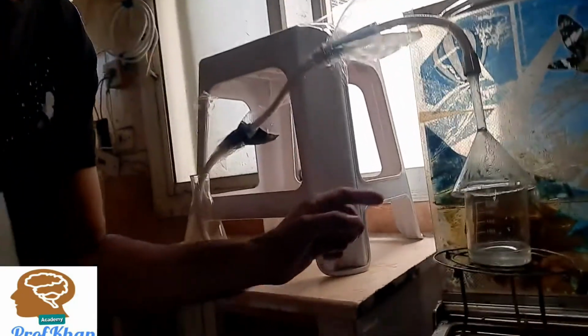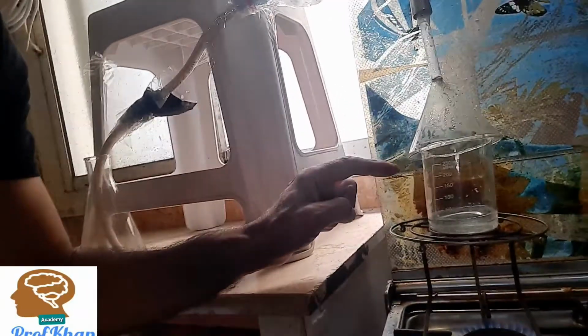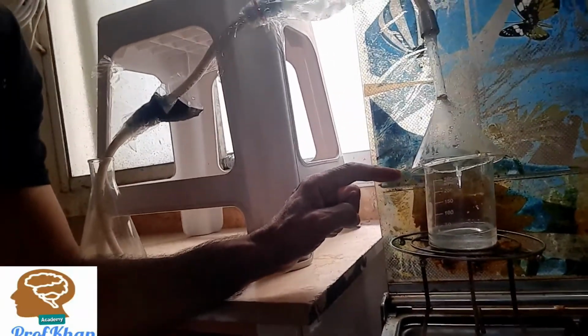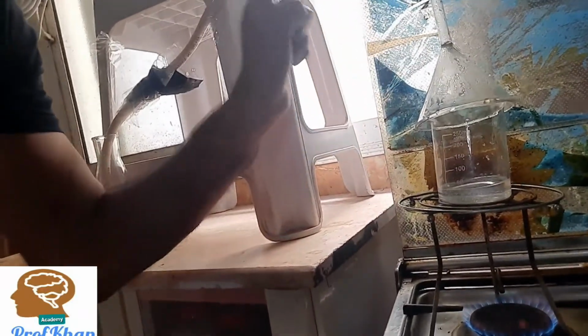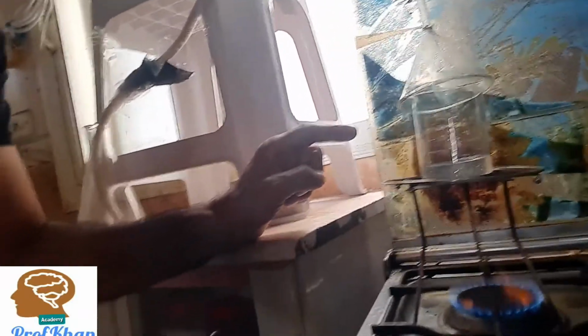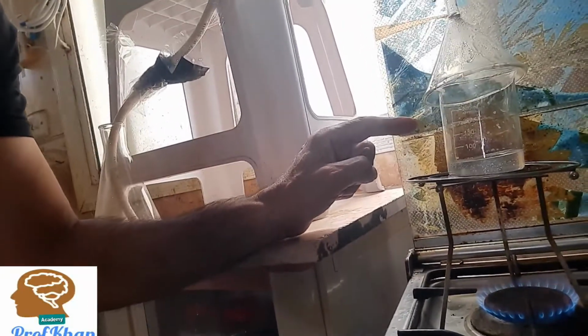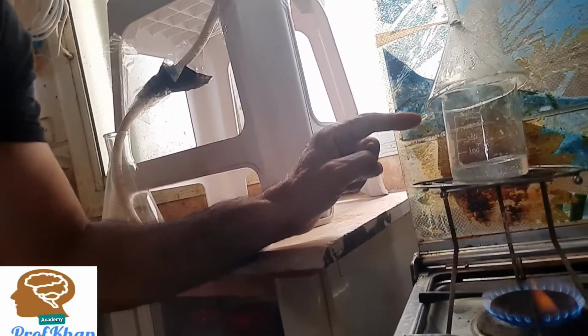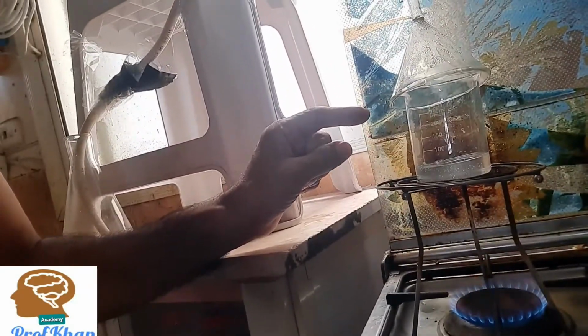Now let's see the first stage here. Here we have a beaker. Inside the beaker you can find a solution of salt. Over the beaker is the funnel, and from the beaker the vapors or the steam will be produced, and then this steam will pass to the delivery tube. Under the beaker you can find the fire. This fire is going to give heat energy to the water such that the water is going to evaporate, and you can see the bubbles are produced, the water starts boiling.